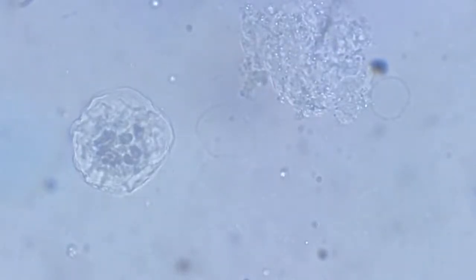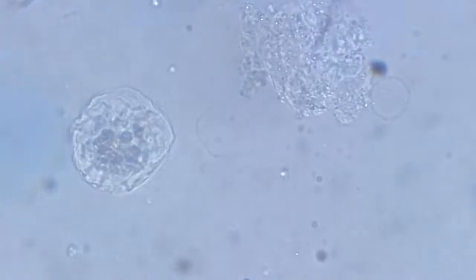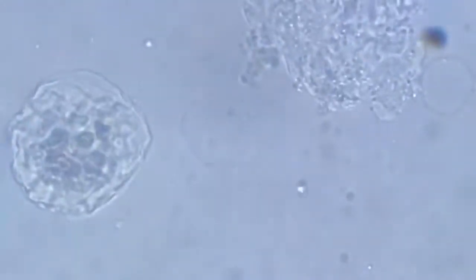Another pseudopodia is now generating itself towards the 12 o'clock to 1 o'clock direction in a very slow but steady manner. A small bump is being generated, which is the ectoplasm, hence it's comparatively very clear. Let's zoom in further at the cost of resolution.